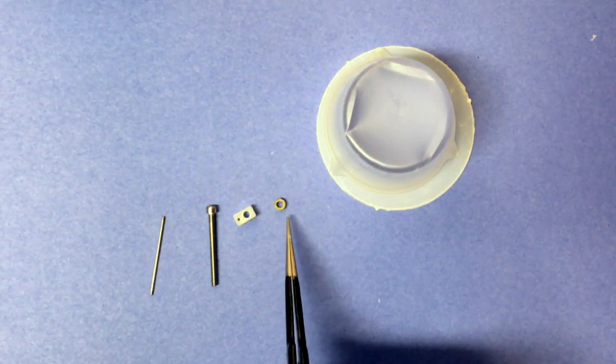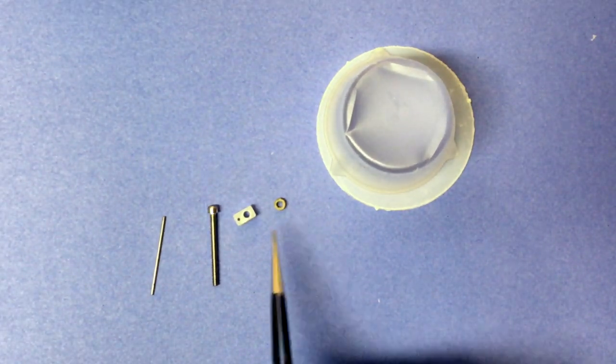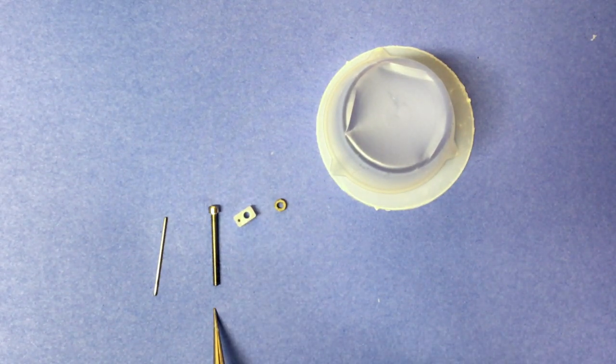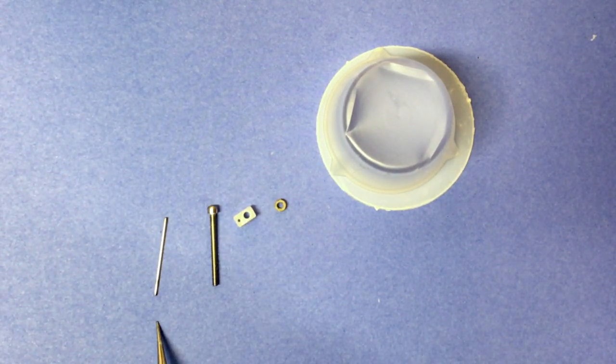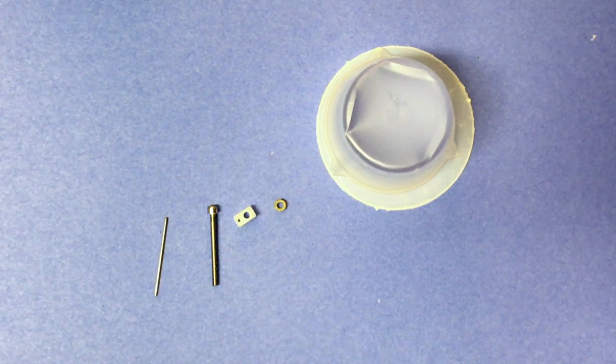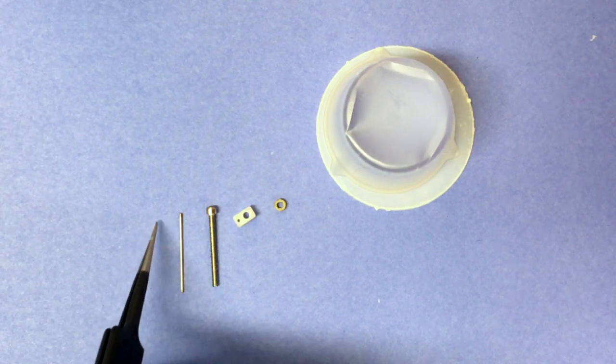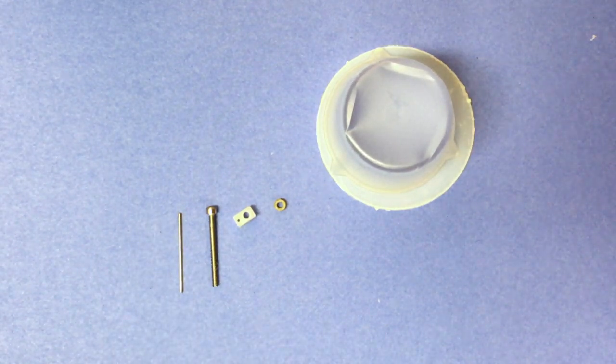This video will teach you how to make a Tetrode carrier. The carrier consists of the gold nut, this white box, a hex screw, and a 23 gauge cannula. You'll want the 23 gauge cannula to be roughly the same size as the hex screw.